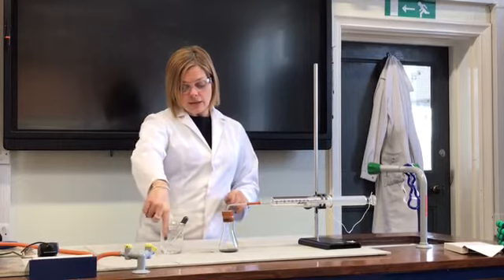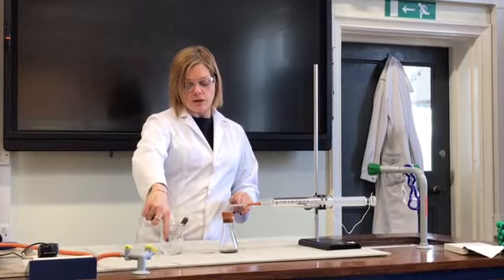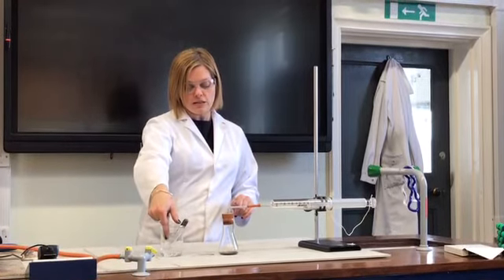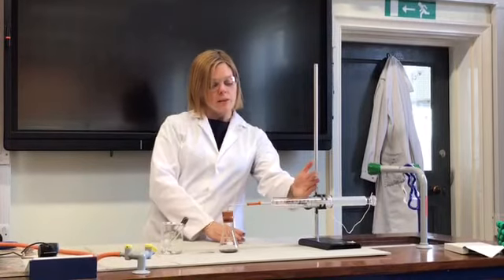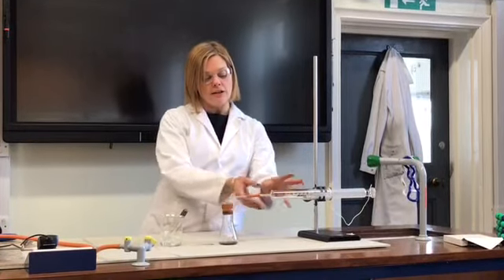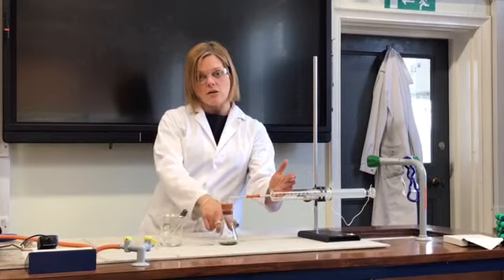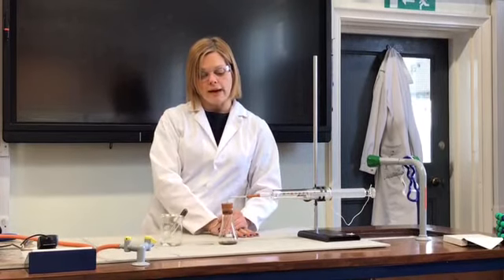And in this case, the water level rises up, so we'll measure that to difference. In this case, we can measure how much the volume of that whole apparatus has decreased as the oxygen is removed from the air.